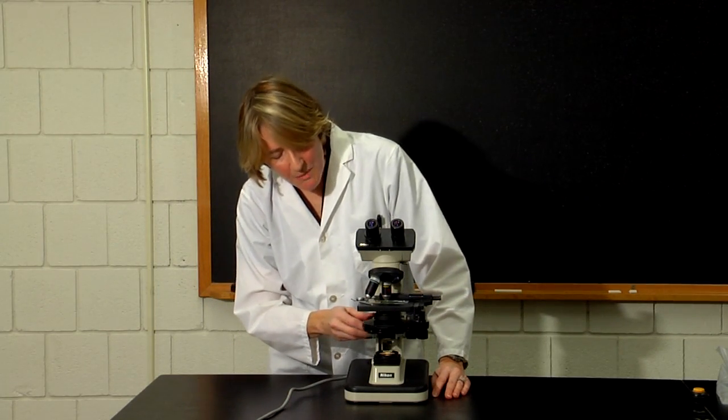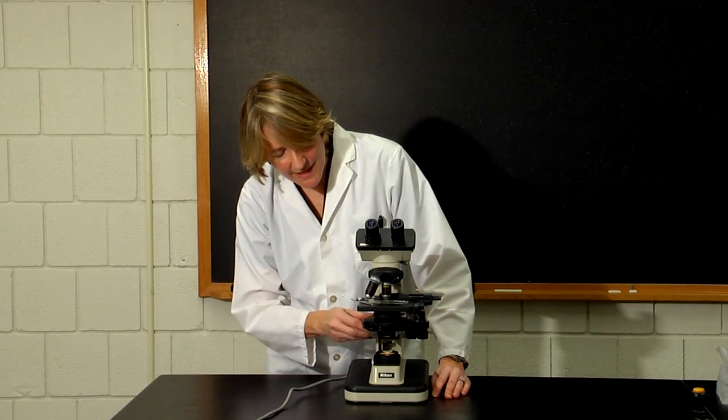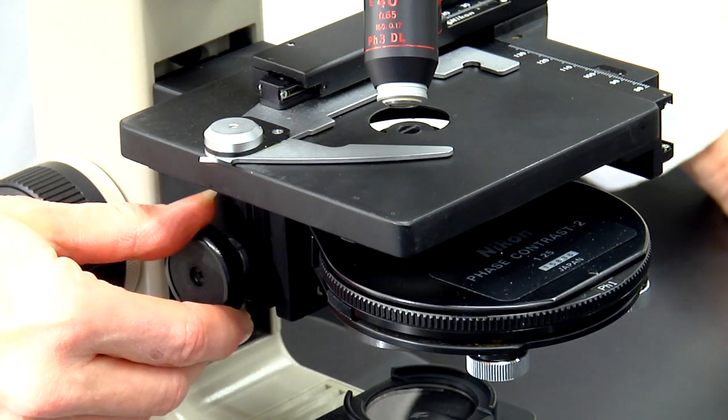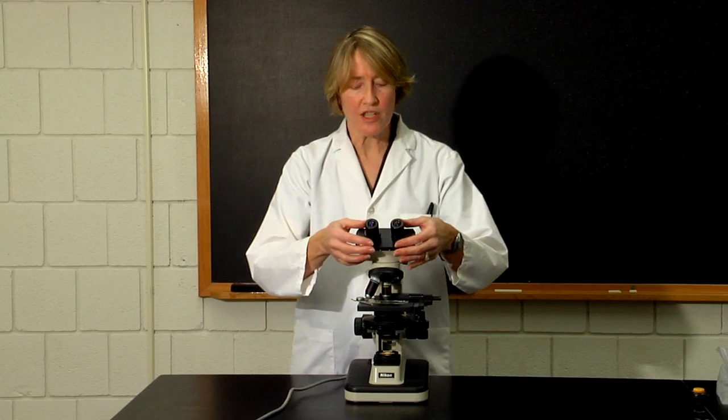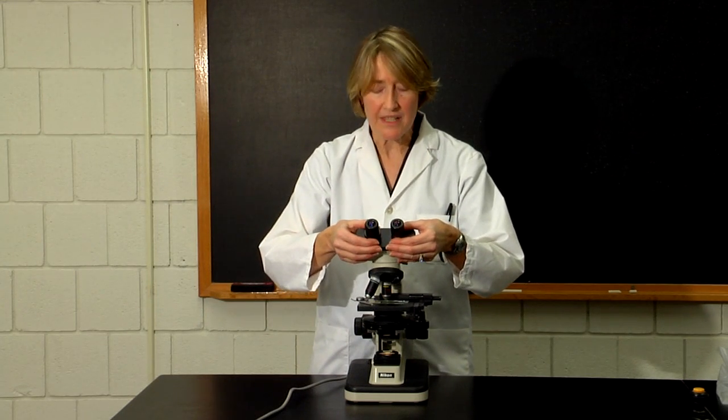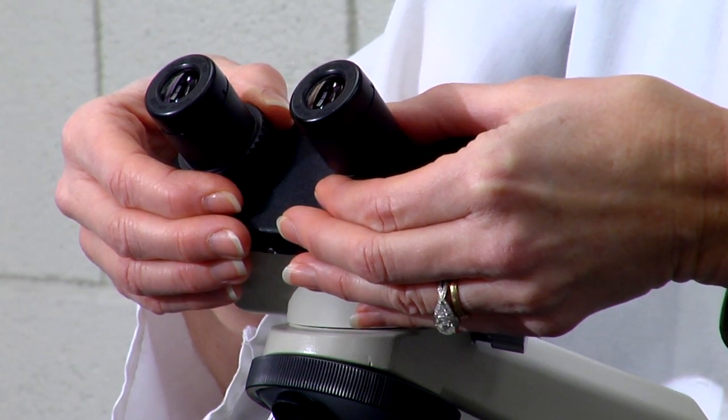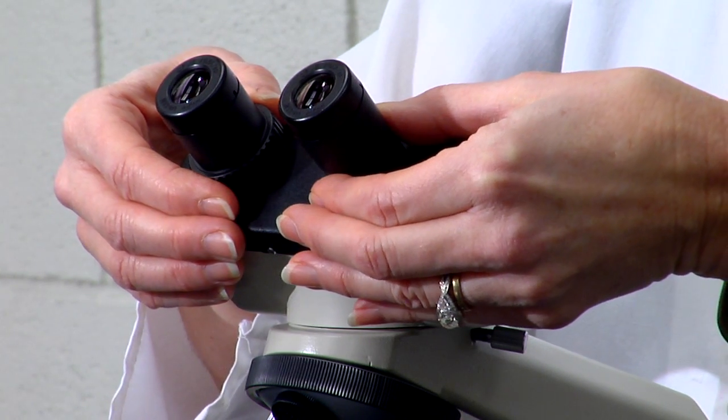Also, you want to make sure that the condenser lens system is in almost the highest position. Before viewing the sample, you should also adjust the width of the eyepieces for your own eyes by sliding the ocular lenses either farther apart or closer together.